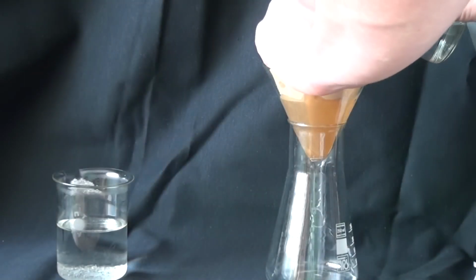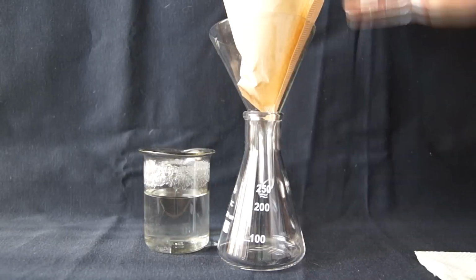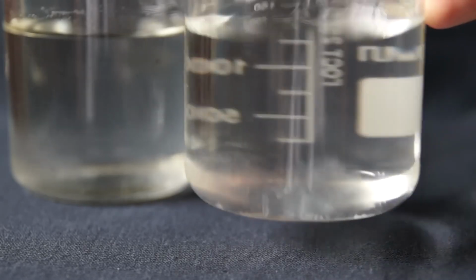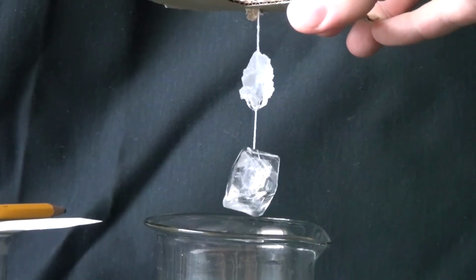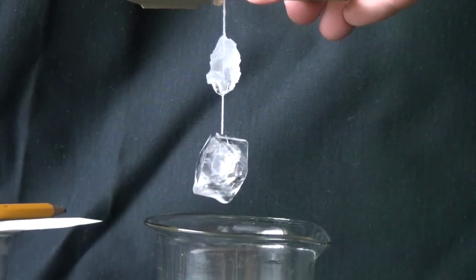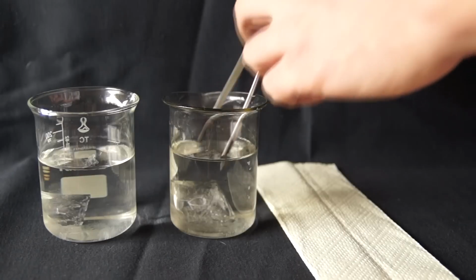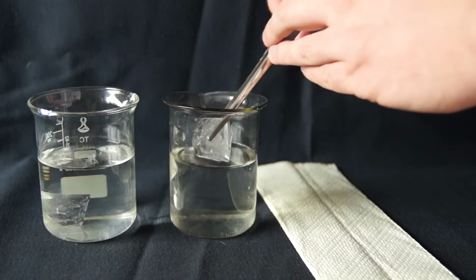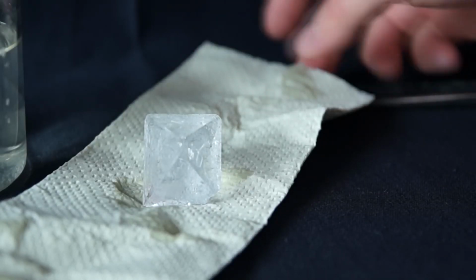Also, once a month or once every 2 weeks, I recommend filtering the solution to maintain its clearness. Over time, some specks or other dirt might appear in the solution, which can spoil the crystal. Over time, my crystal of potassium alum became bigger. As you can see, it has acquired a very interesting form. And now, after about 3 months, I have grown 2 beautiful crystals of potassium alum. They are not perfect and not entirely smooth, but I still got their single crystal structure.